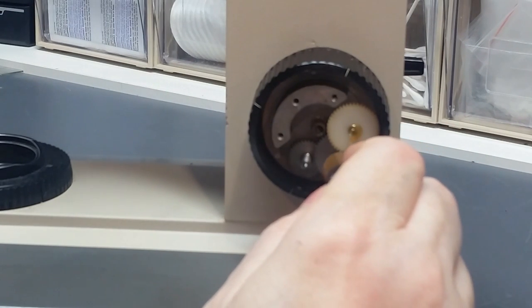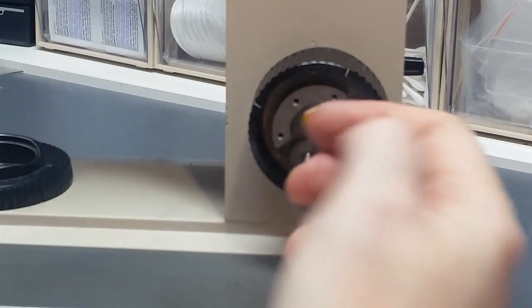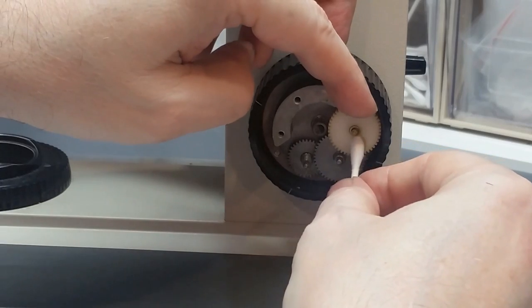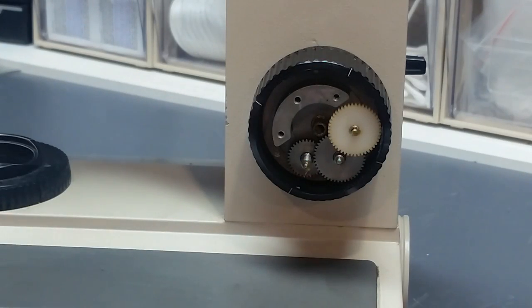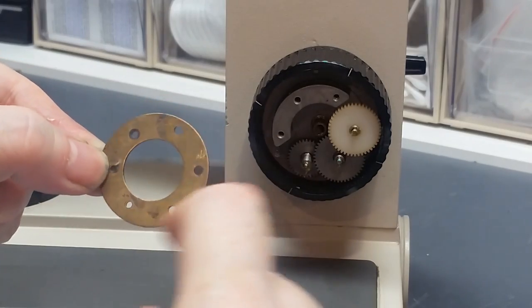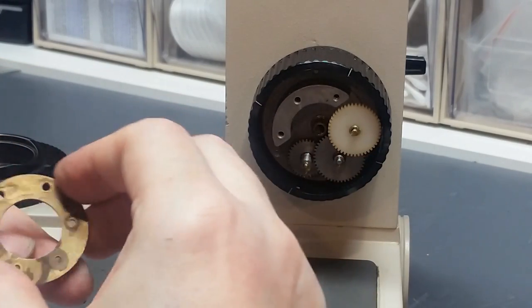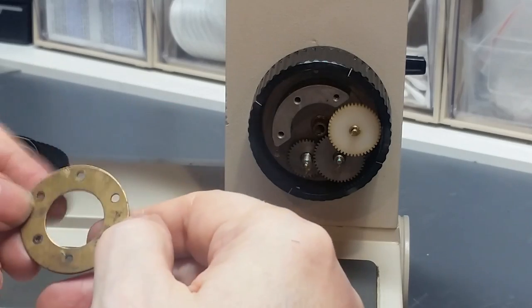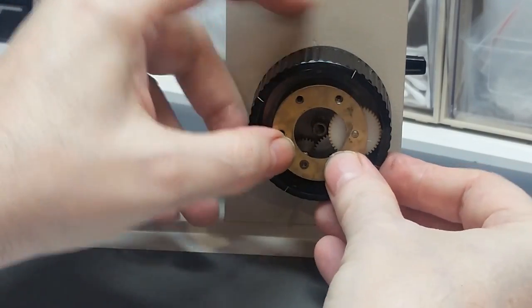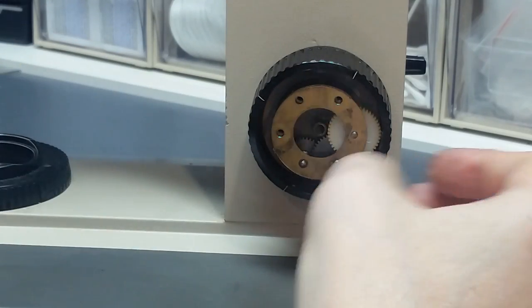That's a little too much, but pull it a little bit on the posts there. And now, this piece has got three big holes and three smaller holes. The smaller holes hold the gears, so put the smaller holes over the pins of the gears, and these three holes here take screws.